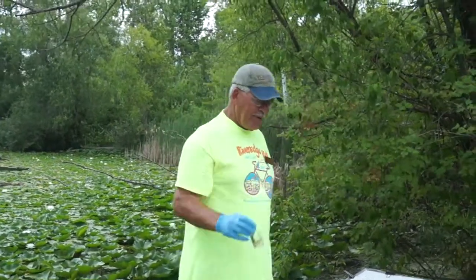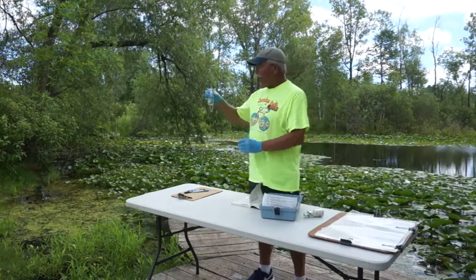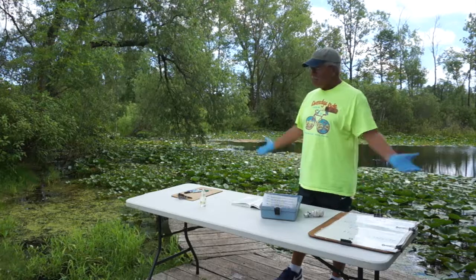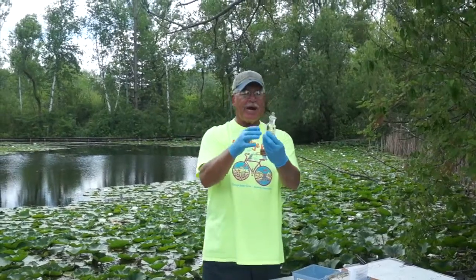So what you're going to want to do with this water that you have here now, just as simple as can be, find yourself either some aluminum foil like this and coat it, or just put it in a dark cabinet for 5 days and forget about it for 5 days. Let it sit for 5 days. Okay? After you're done, it's 5 days later now. So we're pretending.